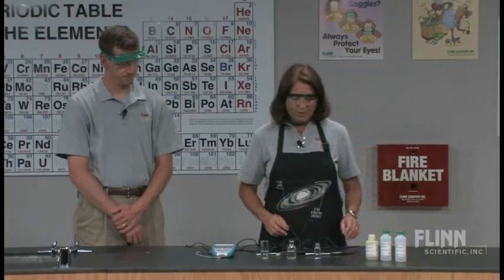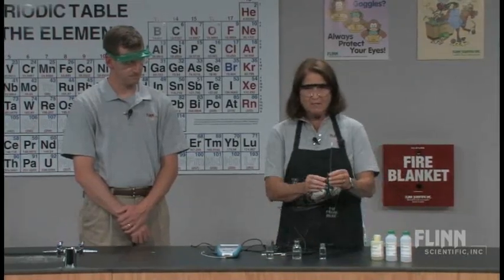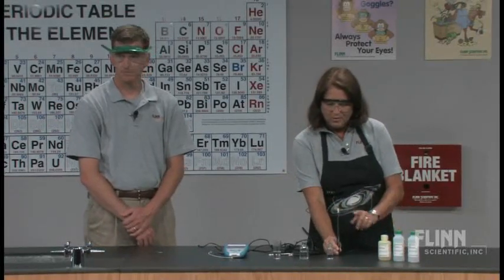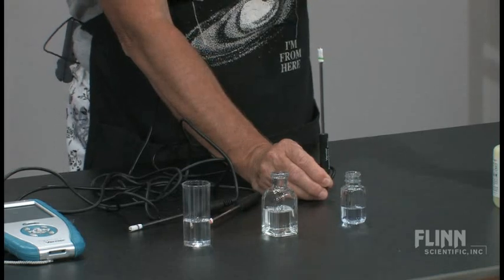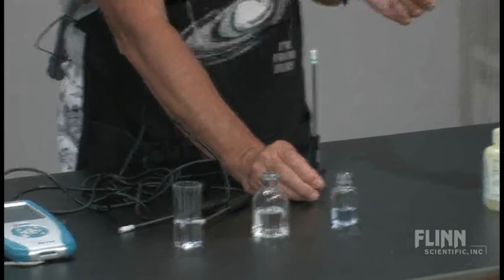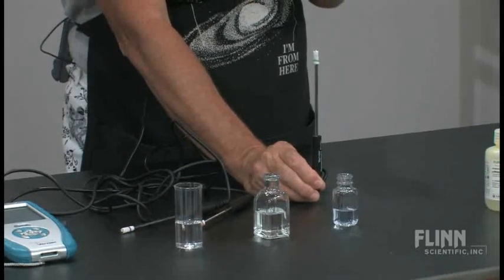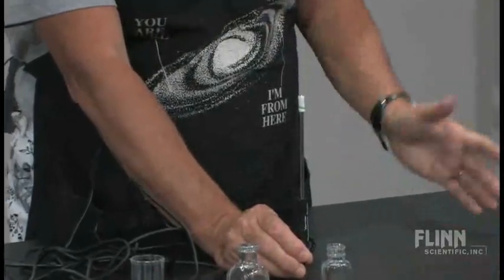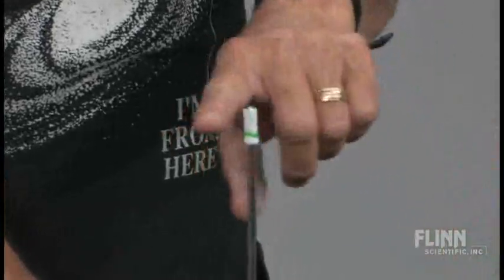The setup is simple. I have three temperature probes like this one. You'll notice that the temperature probe has a piece of paper towel folded around the tip of the probe, which is where the temperature readings are actually detected, and secured with a rubber band so that it will remain at the tip.